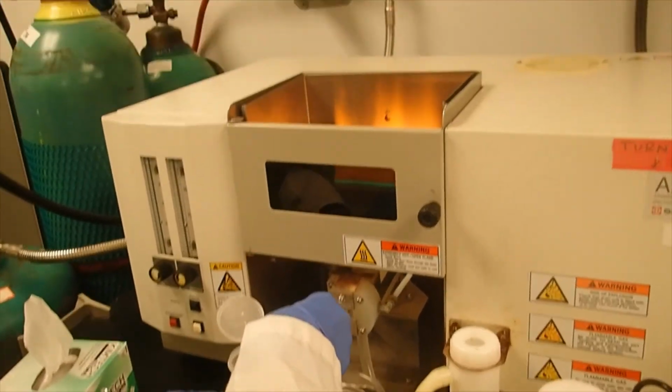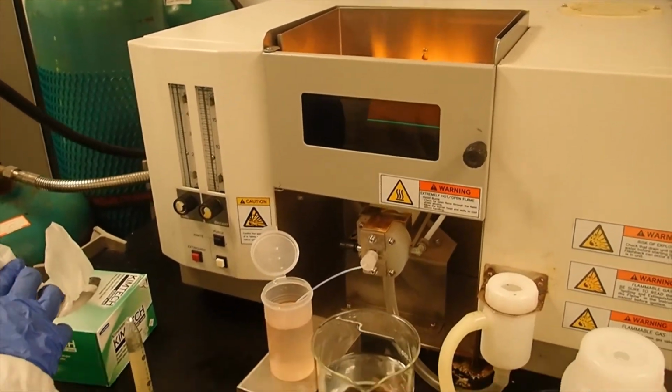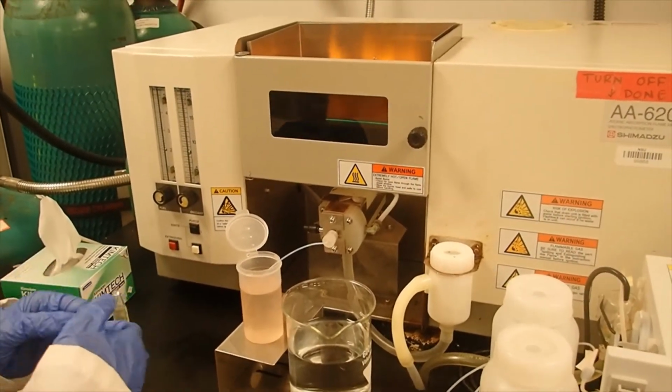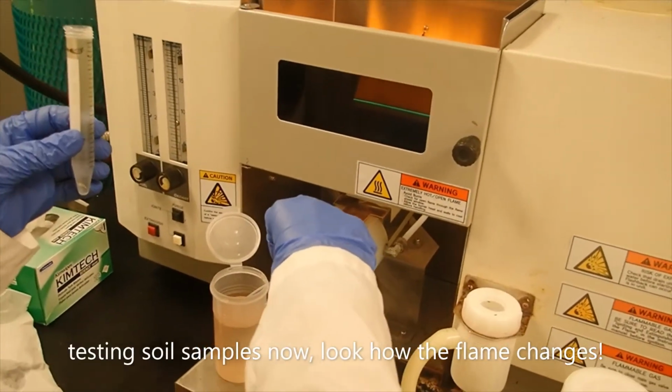This one's not going to look any different because the only difference is that there's more nitric acid and more peroxide in this flame. Okay. That's good.